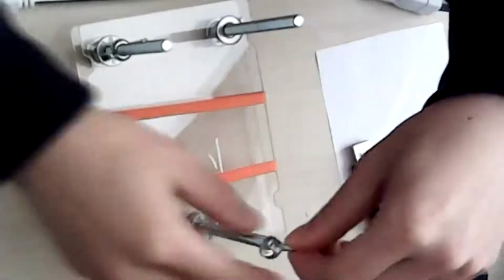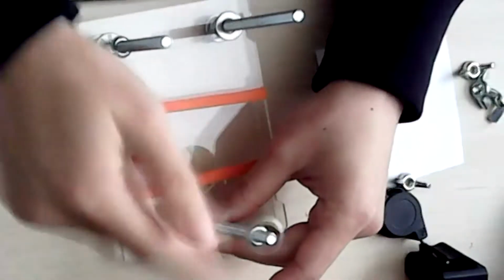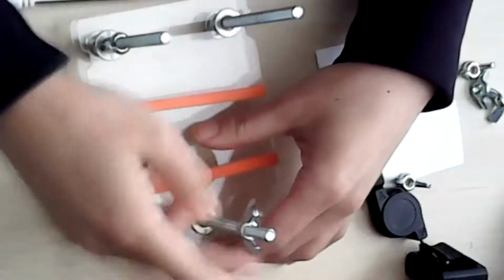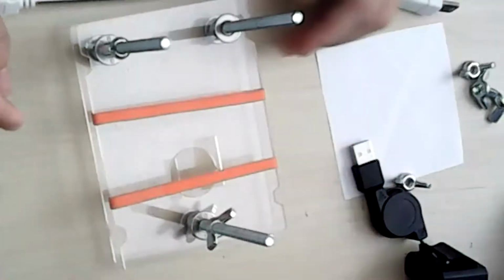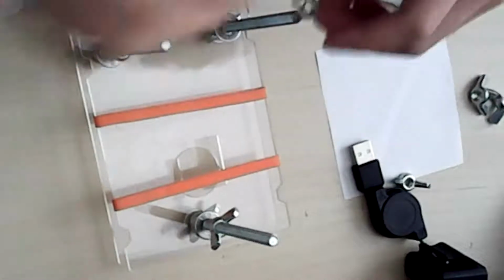So it has not happened to me. This is pretty smooth so far. But yeah, just know that it should be pretty smooth, and you don't have to force it through. And I'm stopping not all the way, and you'll see why.